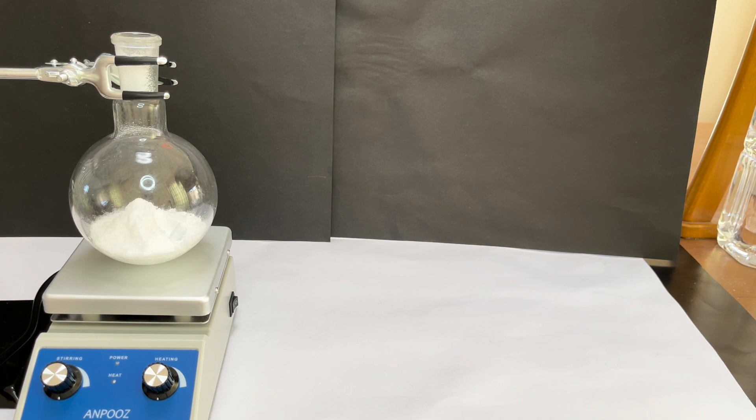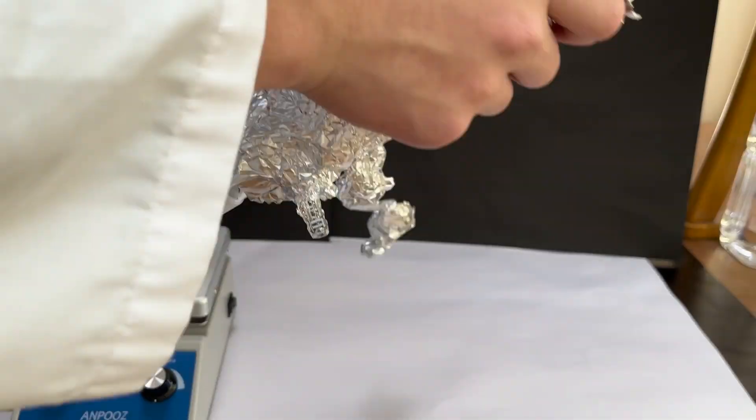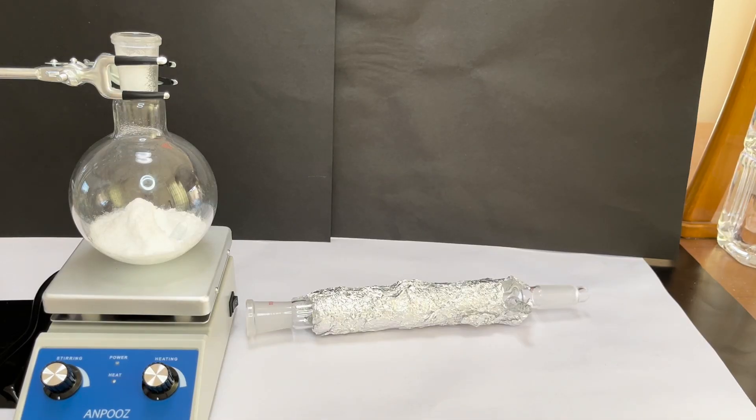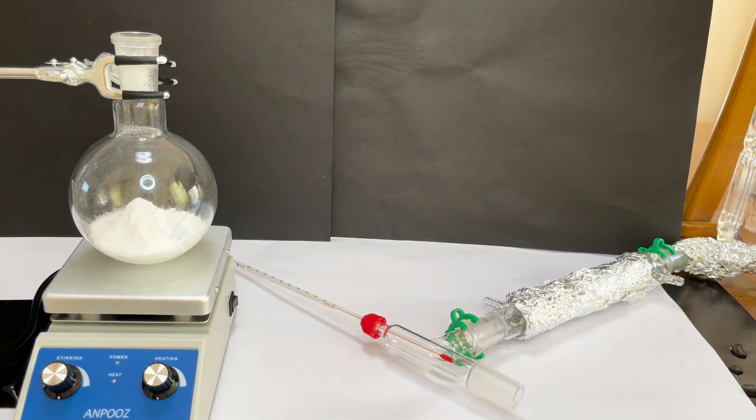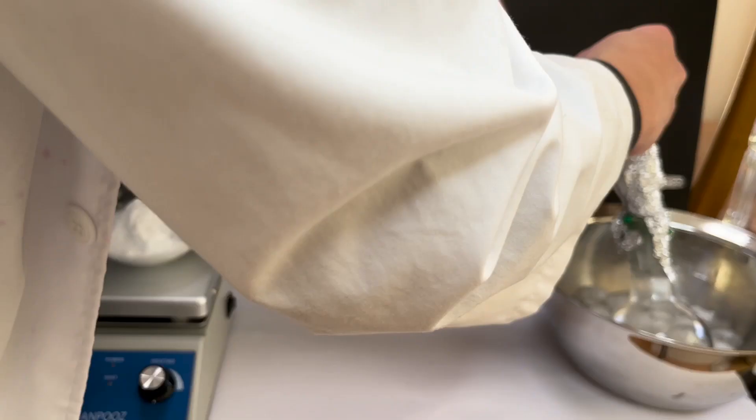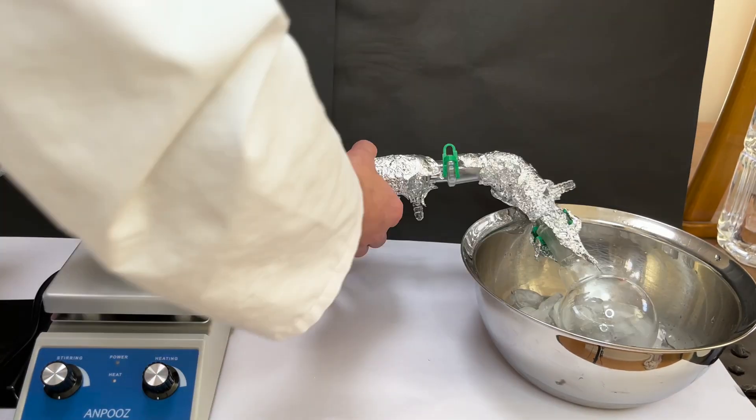As I mentioned before, a distillation cooler is the equipment that can distill something. I have to cover the equipment with aluminum foil because nitric acid can easily decompose with light.